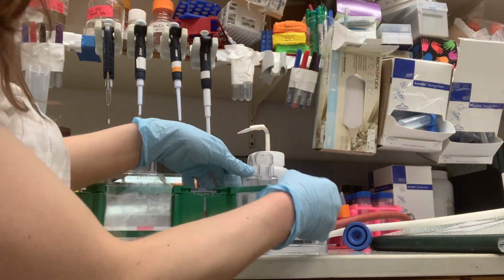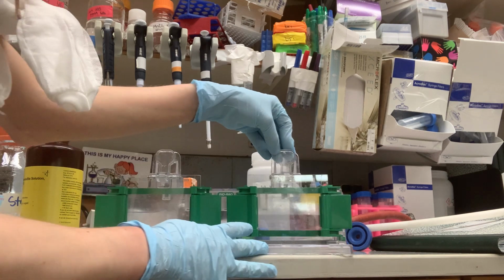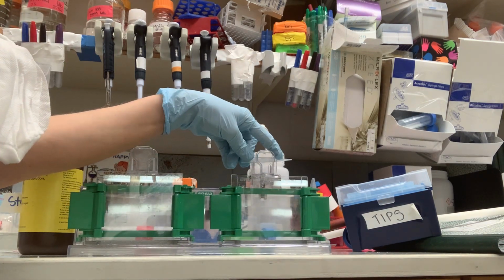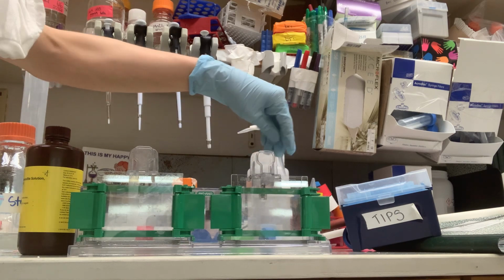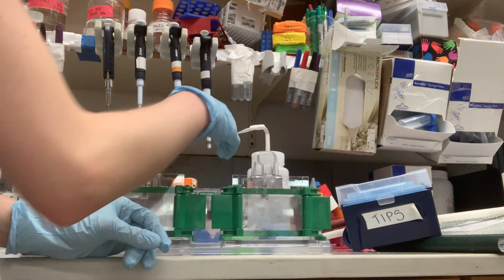So basically this goes down, and then this clamps on top. Sometimes these can come loose, and what can be helpful is if you stick a P1000 tip in here. This can prevent leaking. If you're starting out, it's often good to try just putting water in and seeing if the water leaks, and then you can pour the water out and cast your gel.